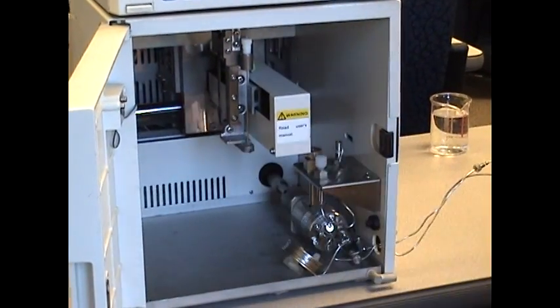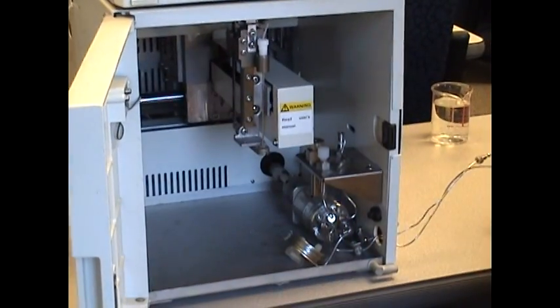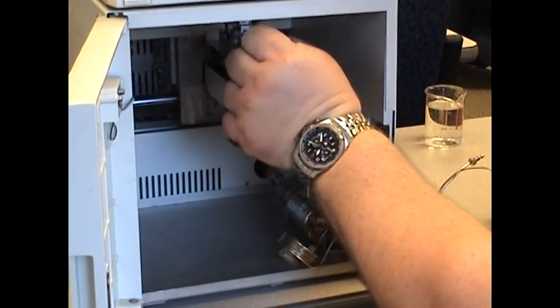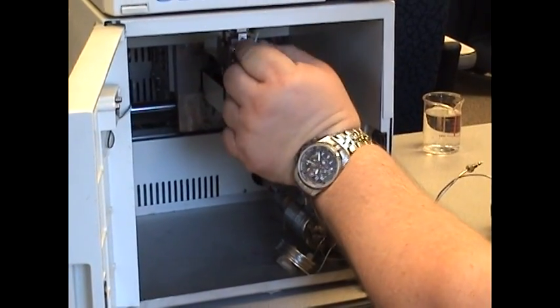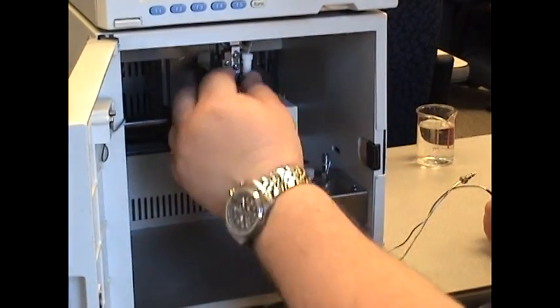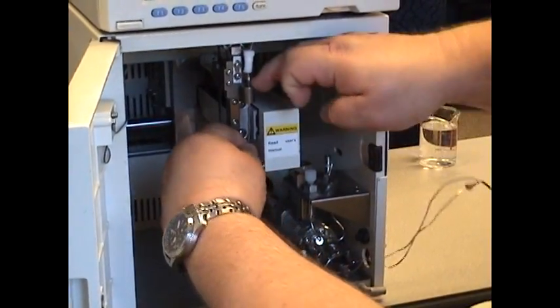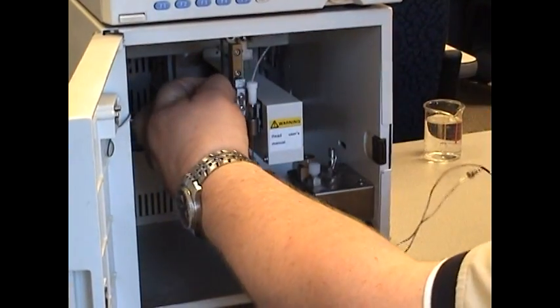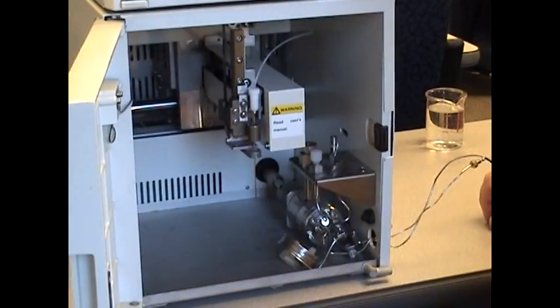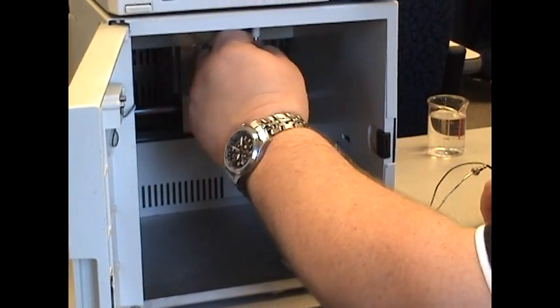Make sure this is in the upright position. Once that is done, we can move it out of the way and move that needle easily forward. Once the needle is out of the way, you can drop this clear to the bottom. That's going to allow you to get some room to lift the needle out. Pull the needle out carefully.